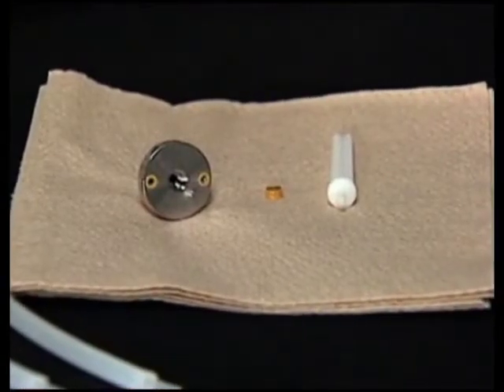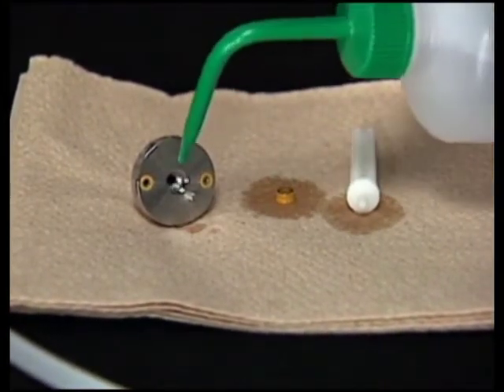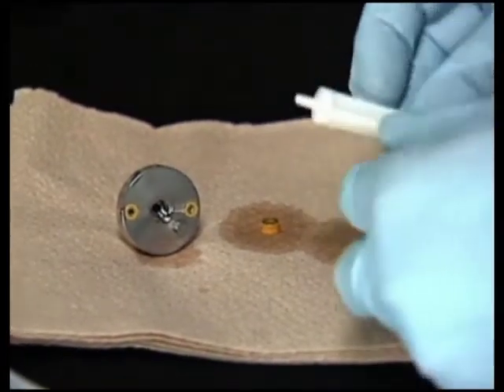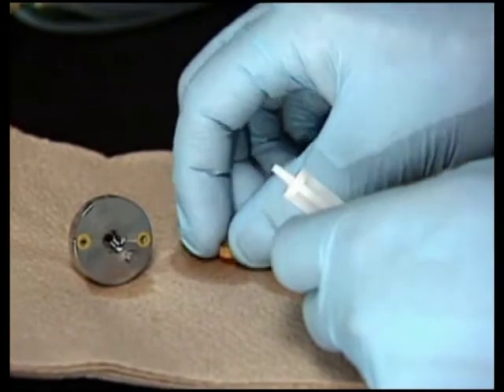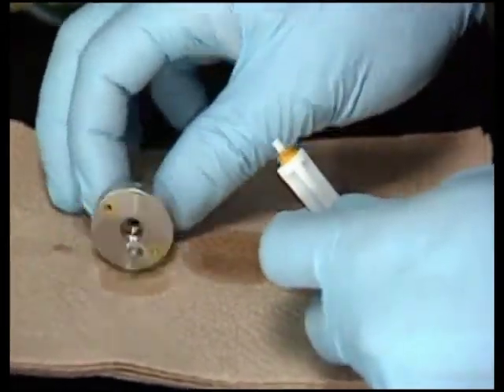Place the head, new plunger seal, and seal insertion tool on a lint-free absorbent towel and thoroughly wet with methanol. Slide the plunger seal onto the seal insertion tool with the spring side exposed and insert the seal into the head.